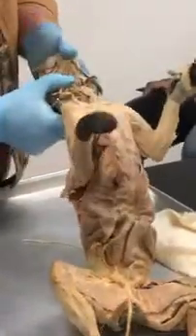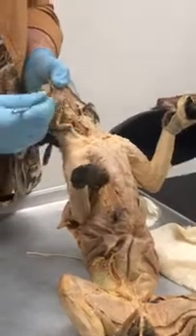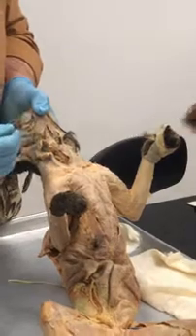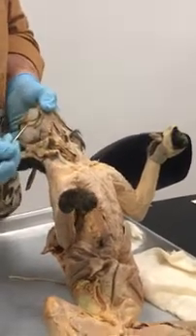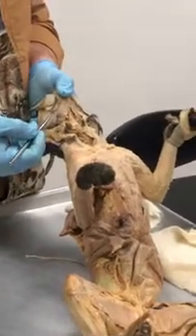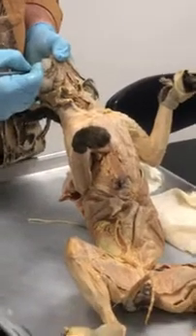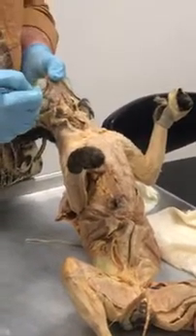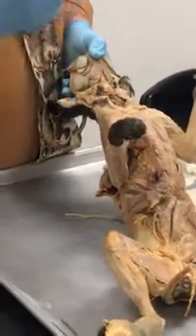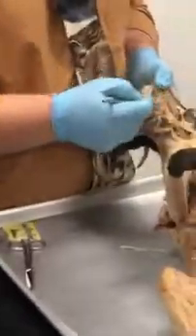So that goes on over here. And then we have another one over here, back to the lower portion. We have one muscle up here and one on this side too. It looks like an upside down V. It attaches to the mandible also. What is that? That's your digastric. And keep in mind, muscles pull, so if they're going to pull the jaw, the action of the digastric is what, specifically? Depression, or opening the mouth, the jaw, the mandible. Does that make sense?